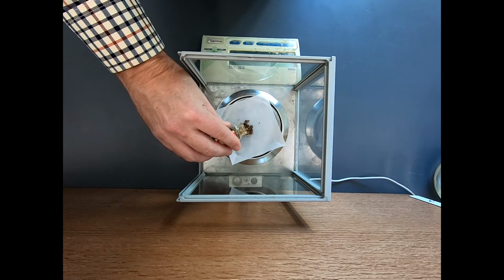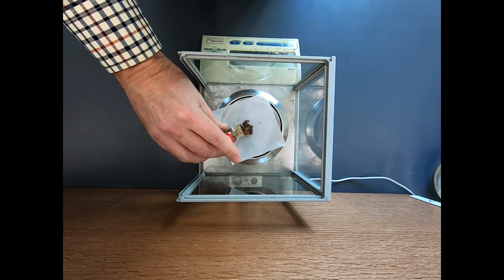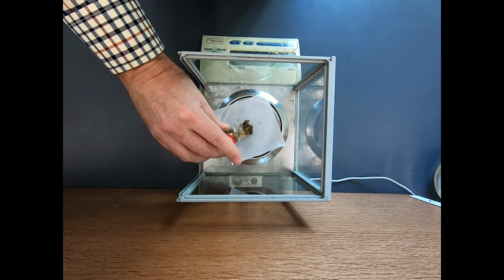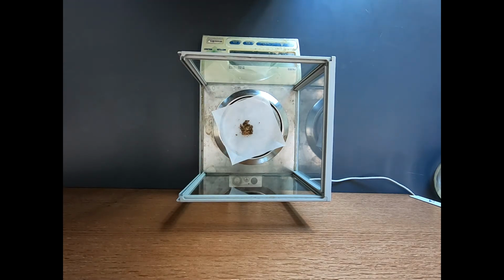Not too bad. That's about 500. And I want to get close, but I'm not going to obsess over being... Ooh, that's 567. That's not too bad. Get some more of these pieces. That's 5... Ooh, that is 578. 579 now. I will take that. That's pretty good. 579. I'm not going to do better than that if I try to mess around with it.